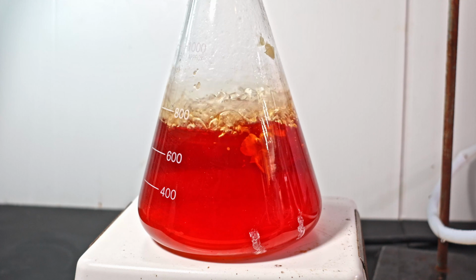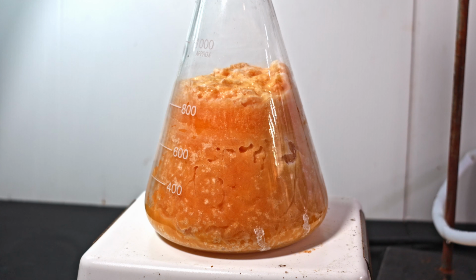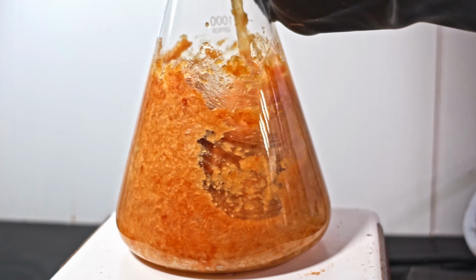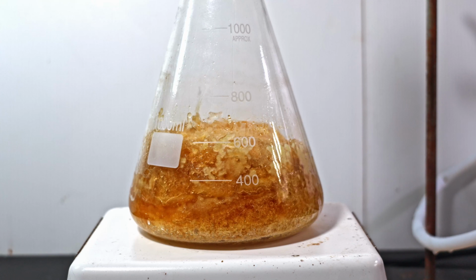Yellow clumps and precipitate occur as free liquid is removed. It eventually turns entirely into this cheesy clod. In time, it dries into an actual block of cheddar cheese. I break it up before I vacuum distill more. When I turn it up to 6, it completely melts back into a red liquid. Vacuuming quickly transformed it back into a yellow sludge, however.